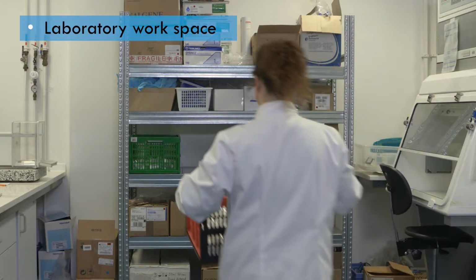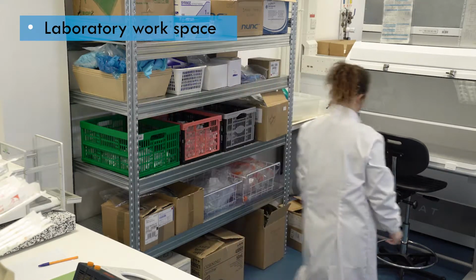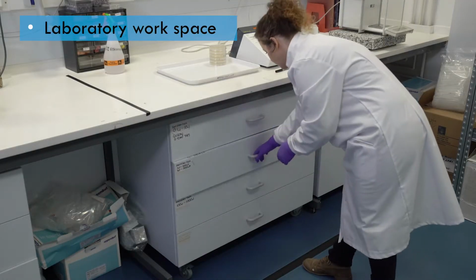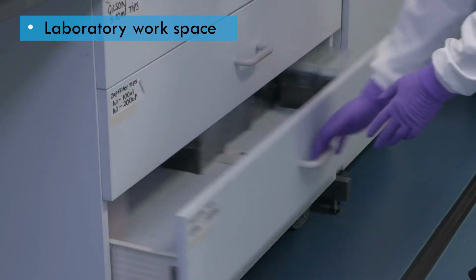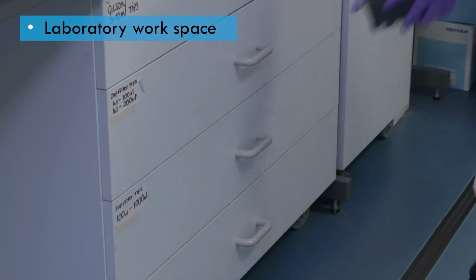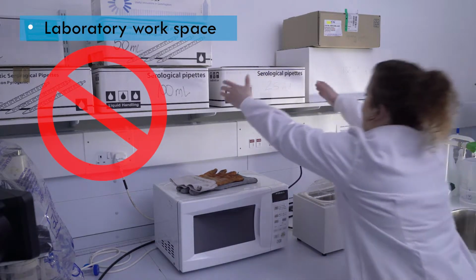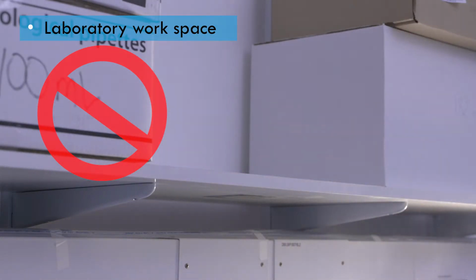Ideally, there should be enough storage space on shelving and in cupboards and drawers to keep the working areas clear. Organize the laboratory space so that any regularly used items, such as spare boxes of pipette tips, are stored in drawers or cupboards near to the work area. Avoid storing items on shelving above the microbiology work area, as any dust that settles there can be dislodged and contaminate the work surface.